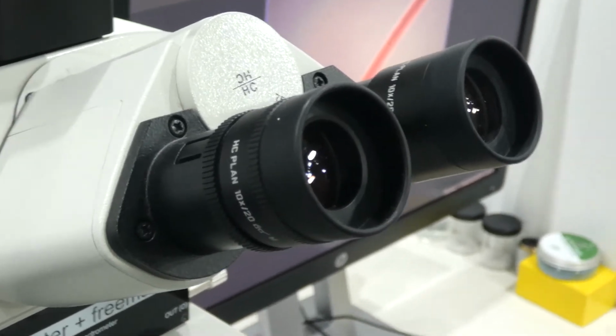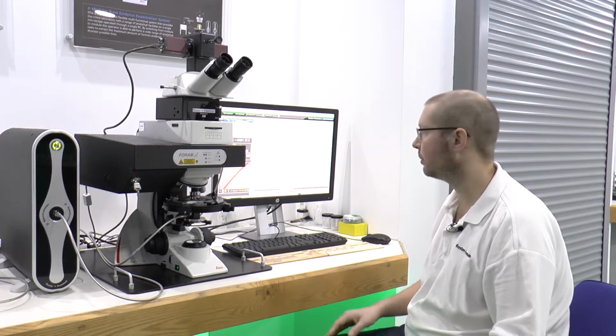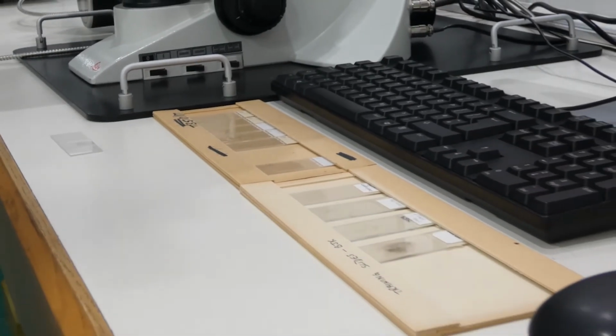Typical number of measurements for man-made fibres would be around 5 or 6, and because natural fibres tend to exhibit more variation, typically you would take somewhere between 10 and 12 measurements. So we'll take 5 measurements for this particular fibre here that I can see as a man-made fibre, and then we'll repeat the process for our questioned fibres.